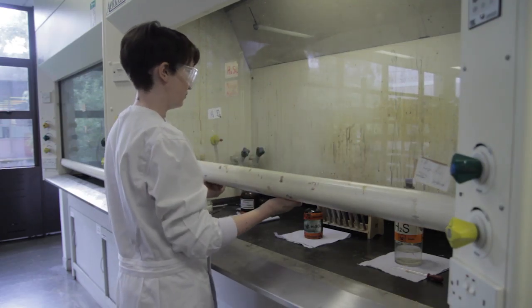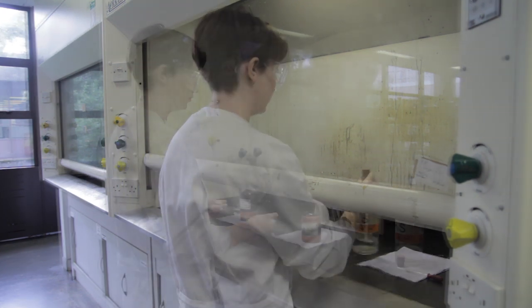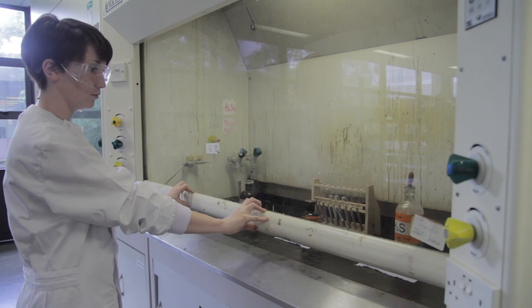When working in the fume hood, make sure the hood is pulled down as far as possible so that your face and chest are covered. When finished, make sure the fume hood is pulled down fully.